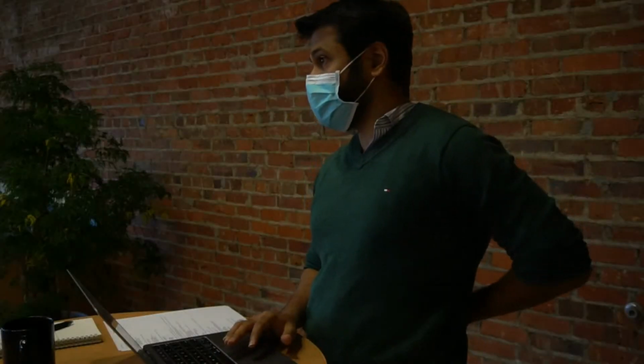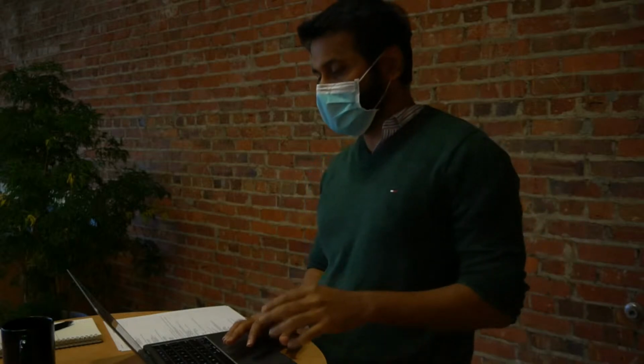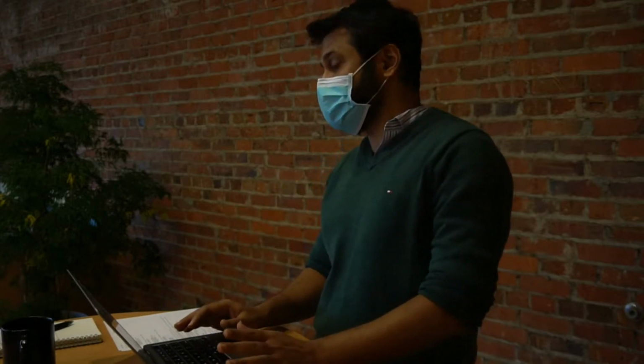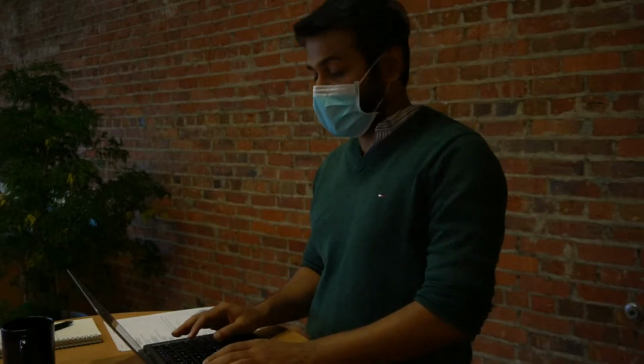Welcome back. So today we're going to dive deeper into RNA-Seq analysis using the output of the DESeq2 package. This is following on from what we did last week. Today there won't be any slides. It's all just going to be coding.